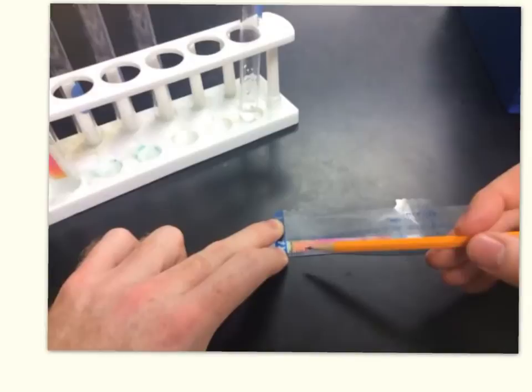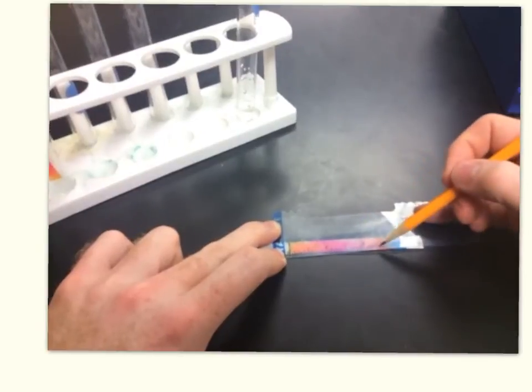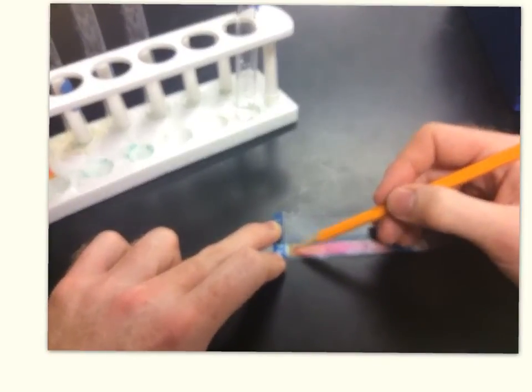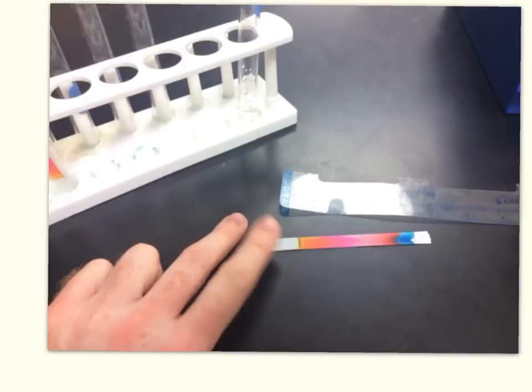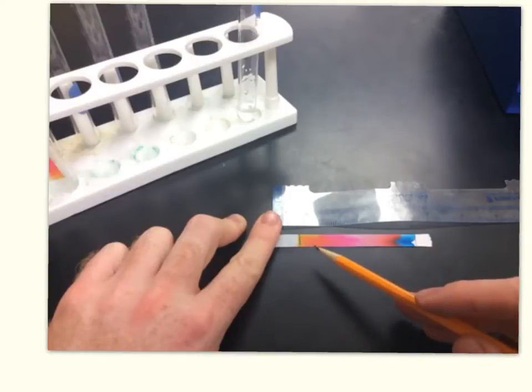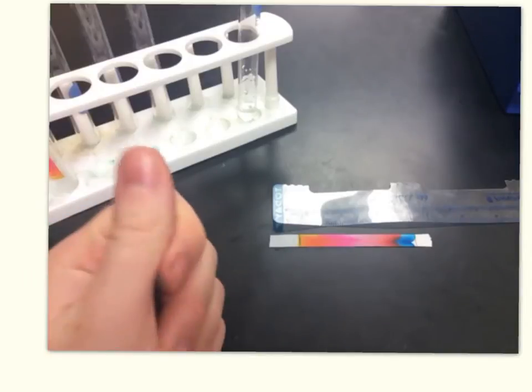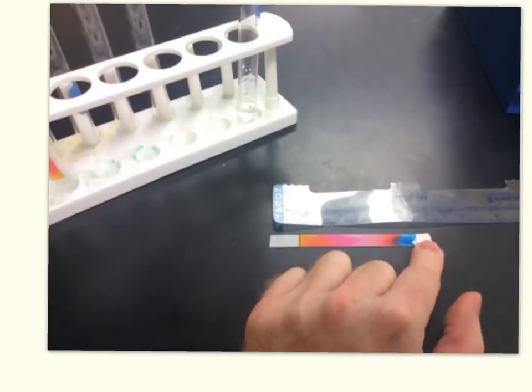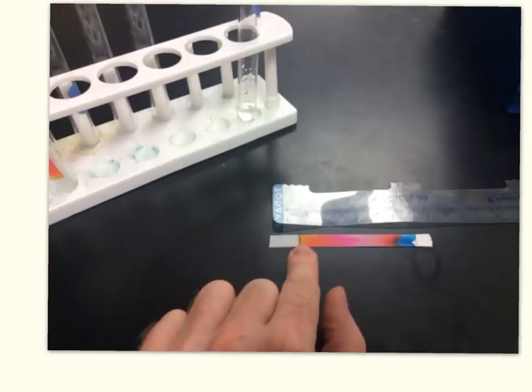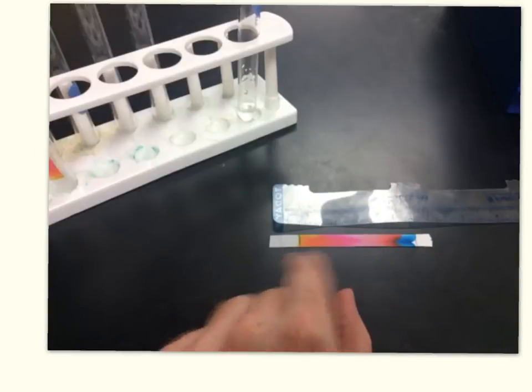Do the same thing for every other color: from the starting mark to the middle of the orange, from the starting mark to the middle of this dark red color, starting mark to the middle of the blue, starting mark to the middle of the yellow. So for this particular marker, I'm going to have a distance measurement for every single color I can see — yellow, orange, pink, red, and blue. So I have the total distance from the starting mark to where the solvent stopped, plus a distance measurement for every color from the starting mark to the middle of each band.